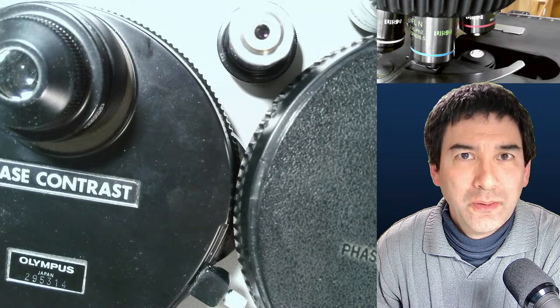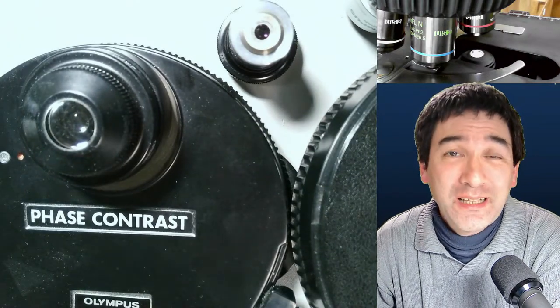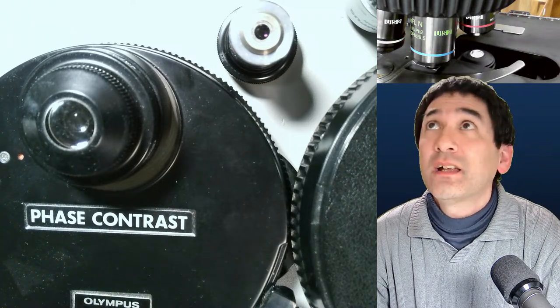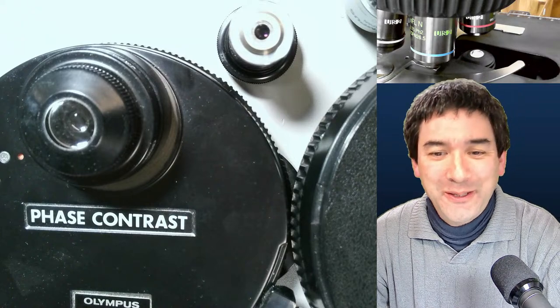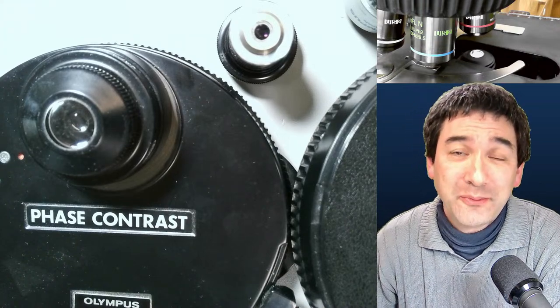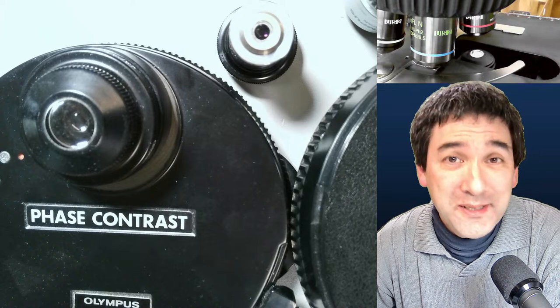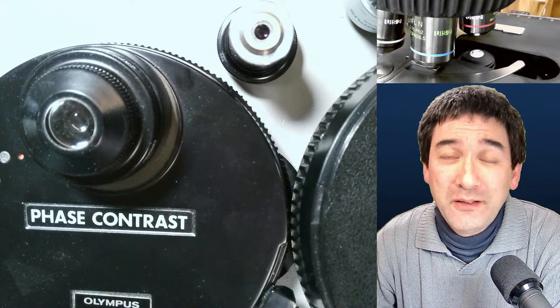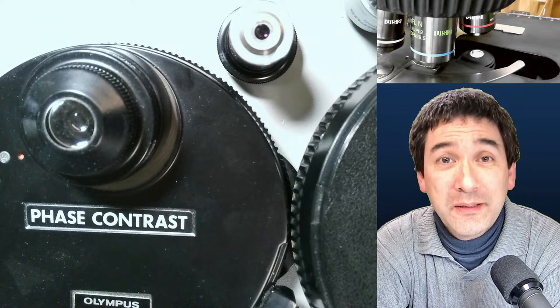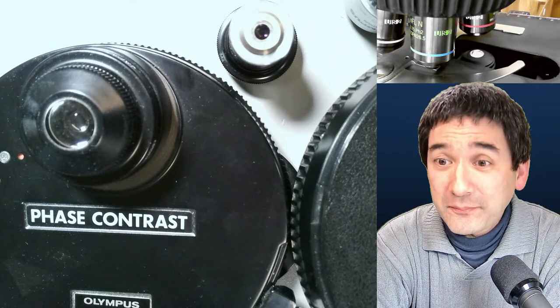Hello everyone, welcome to another microscopy live stream. Today is Sunday — usually I have the live streams on Saturday, but for organizational reasons I had to move it. Today I've decided, because I received a question and a request, to talk about phase contrast microscopy. Even though I've been using phase contrast every now and then in my videos, I thought I should dedicate a whole episode to it.